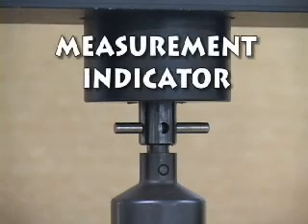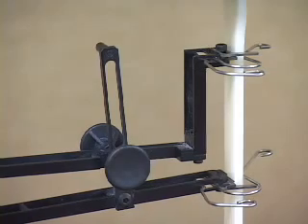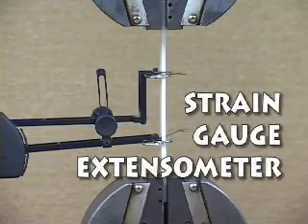It also includes a force measurement indicator capable of showing the total tensile load carried by the test specimen during the test. An extension indicator, in this case a strain gauge extensometer, which attaches to the gauge area of the test specimen and records the distance between 2 points as the specimen stretches.